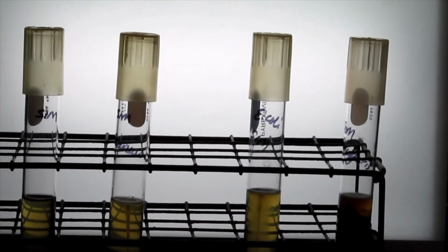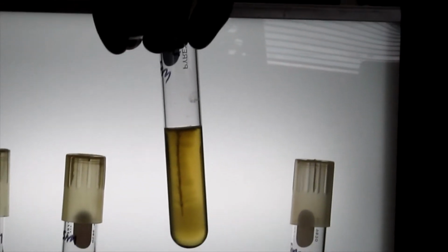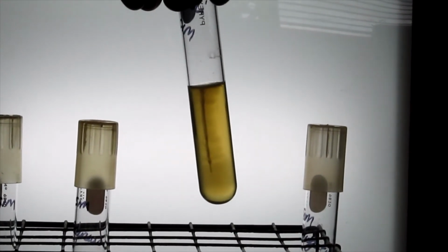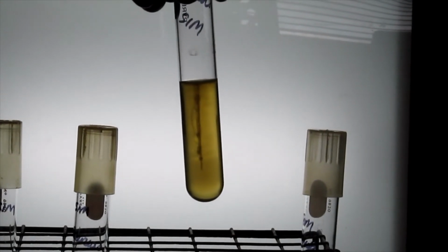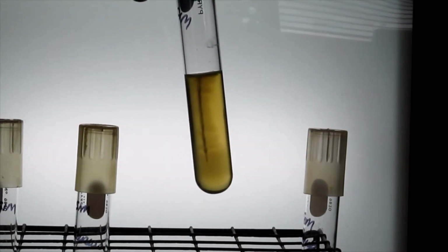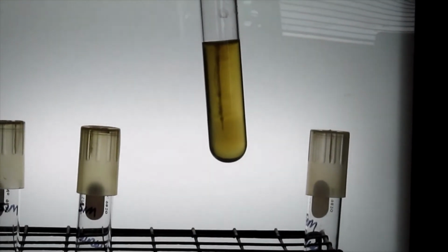If something were motile, you would see this sort of behavior where you can see growth away from the area where the bacteria was inoculated, and so you can say, this bacteria is different from this bacteria here, in that the bacteria is motile.